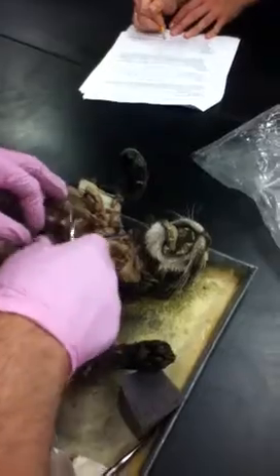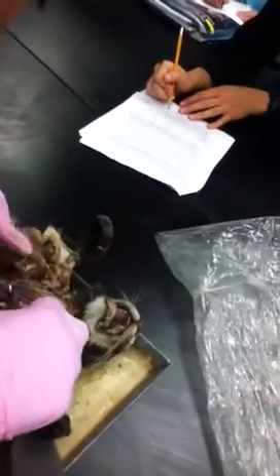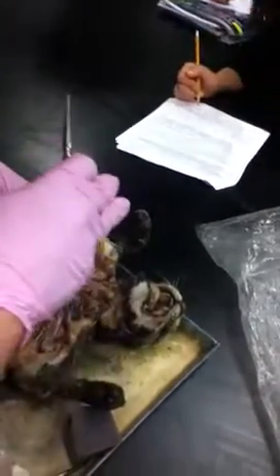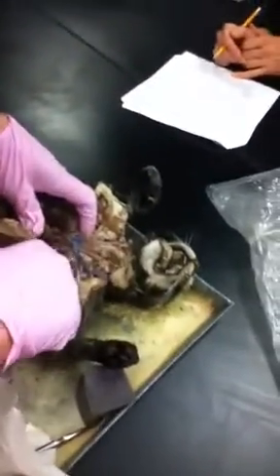While we're up here, we've got this great inferior vena cava branching into our brachiocephalic. Superior. You mean superior vena cava. All right. Come on now, get it right.